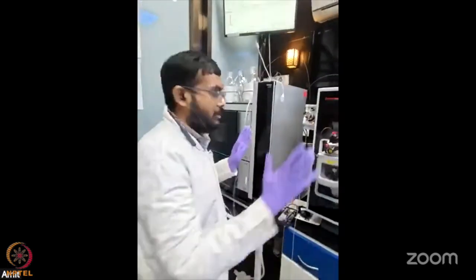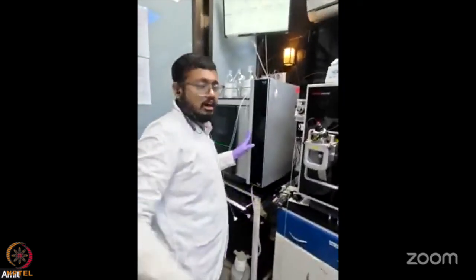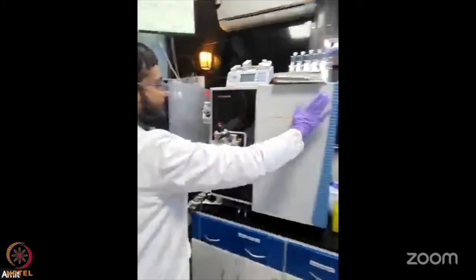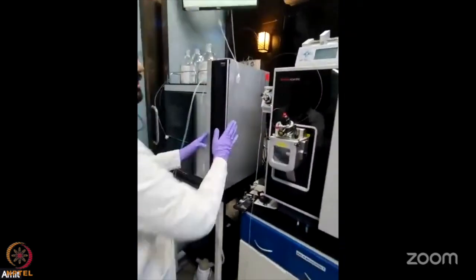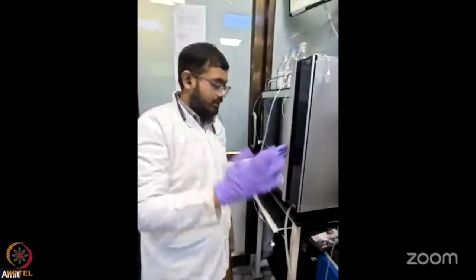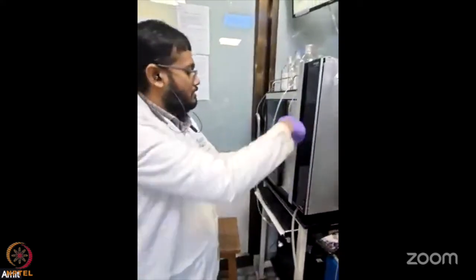Yes, sir. Thank you, sir, for the brief overview of targeted proteomics and the instrument. So what I have shown you earlier is the Fusion, and Amit has shown the QE. Now one of the instruments we are going to show you is the triple quadrupole based one, the TSQ Altis, and it is again coupled with an HPLC. This is not coupled with a nano LC like the one on the Fusion.